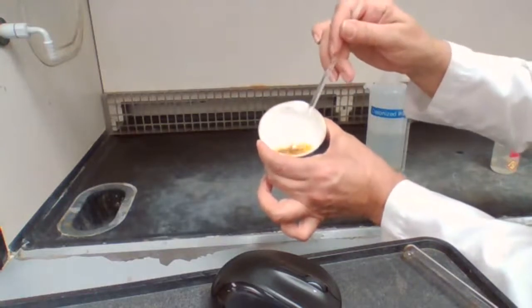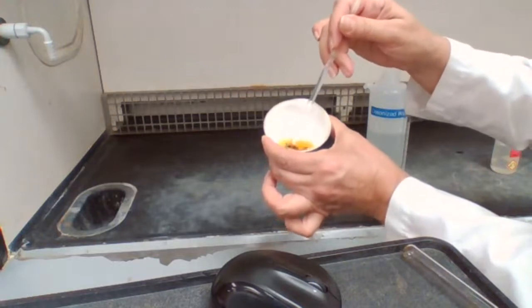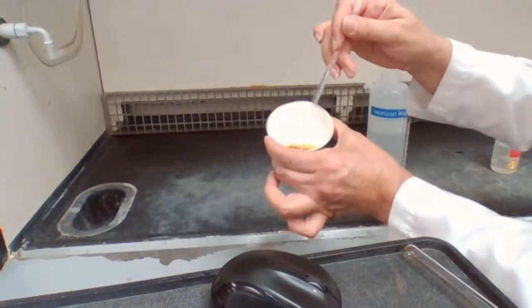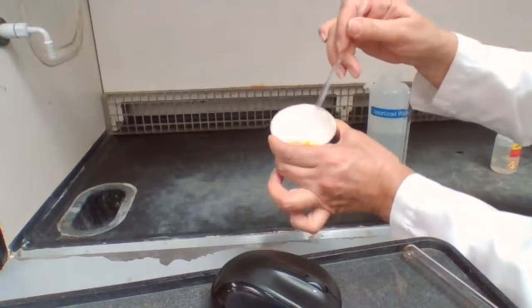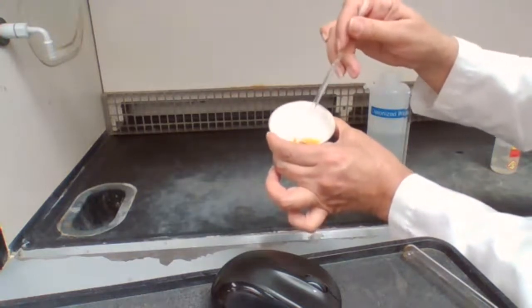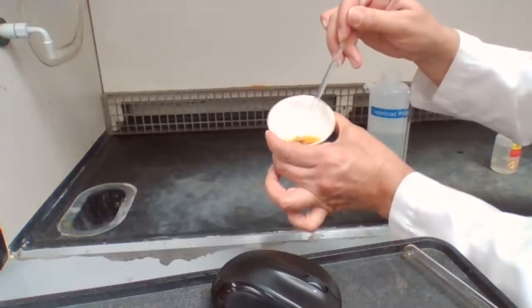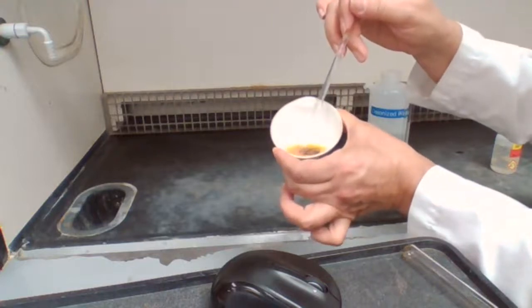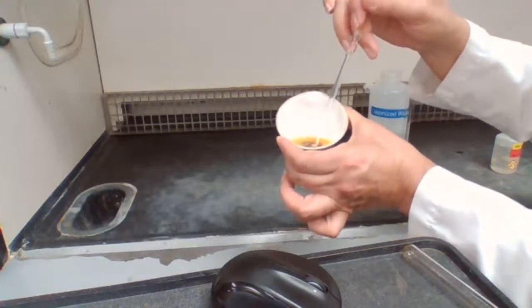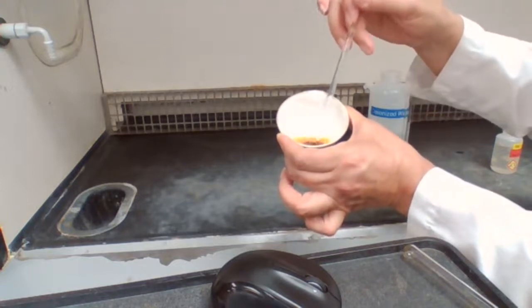One evidence for the iodine being consumed entirely is if the yellow color goes away and changes to clear. Until the yellow color is gone, we are not sure that there isn't some iodine left over. So it's going to get more brown before it gets colorless, because the iodine that is here now is reacting.